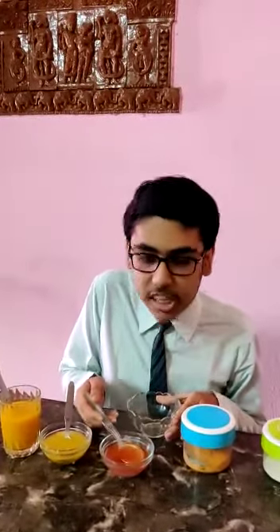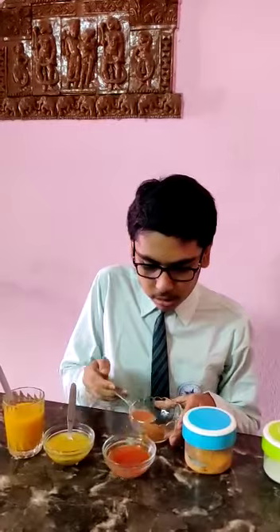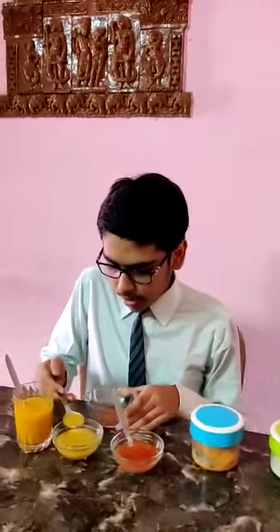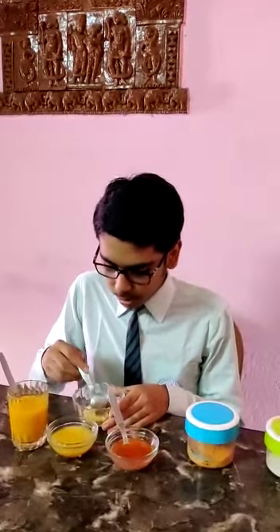Next I will show how the neutralization reaction will occur. I will pour some basic solution, then I will pour some acidic solution until its color changes to the turmeric solution's color. Now you can find that the color has changed to the turmeric solution color.